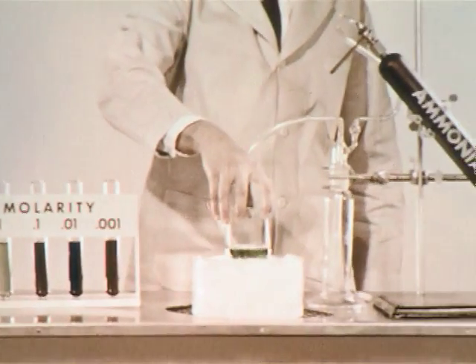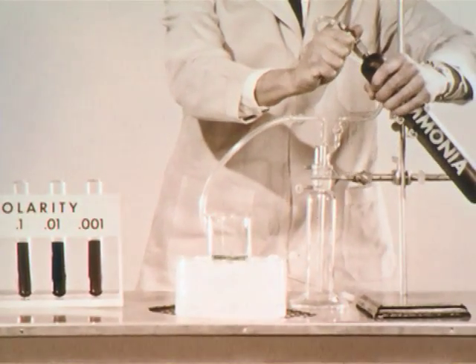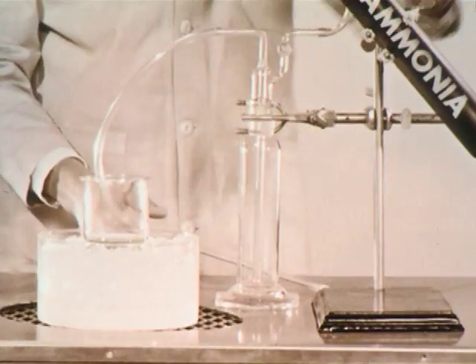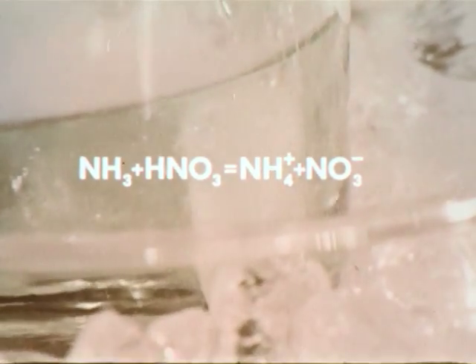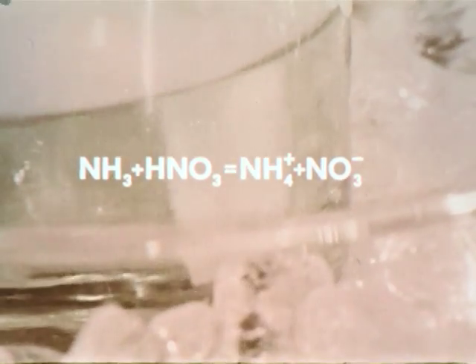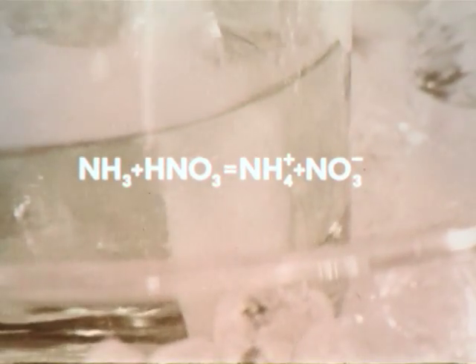If we add ammonia gas to concentrated nitric acid, the acidity should decrease. The safety trap would catch any backup of nitric acid. The ice bath absorbs most of the heat of the reaction. A glass tube with a porous tip is used to introduce tiny bubbles of ammonia gas into the nitric acid. The white smoke, solid ammonium nitrate, forms when gaseous ammonia and gaseous nitric acid react above the solution. The net reaction is ammonia plus nitric acid gives ammonium nitrate, but most of the reaction occurs in the solution, forming aqueous ammonium ions and nitrate ions.